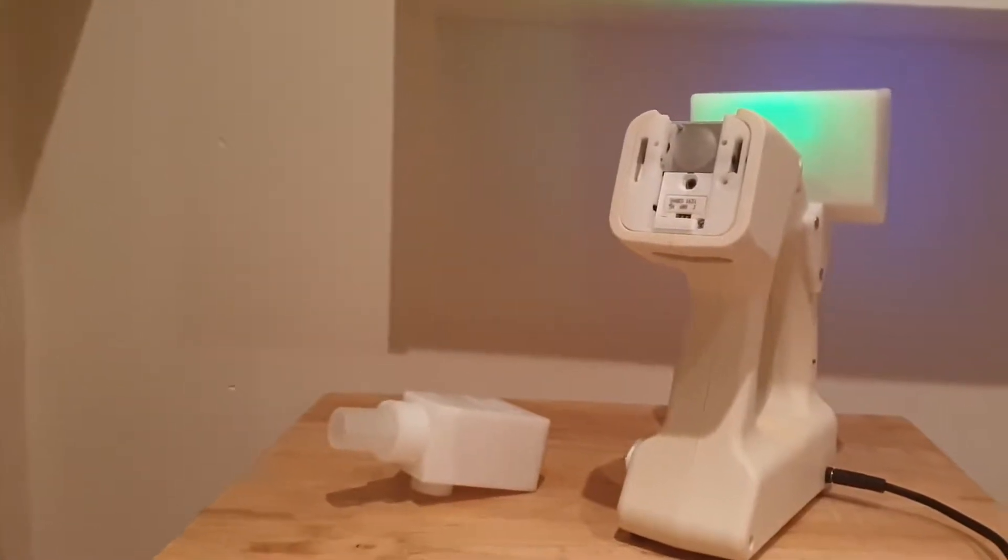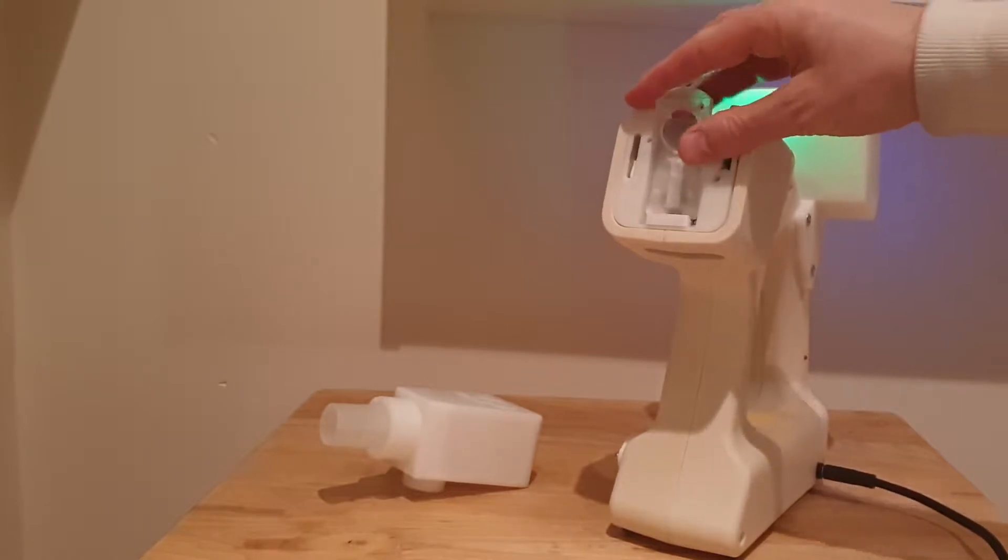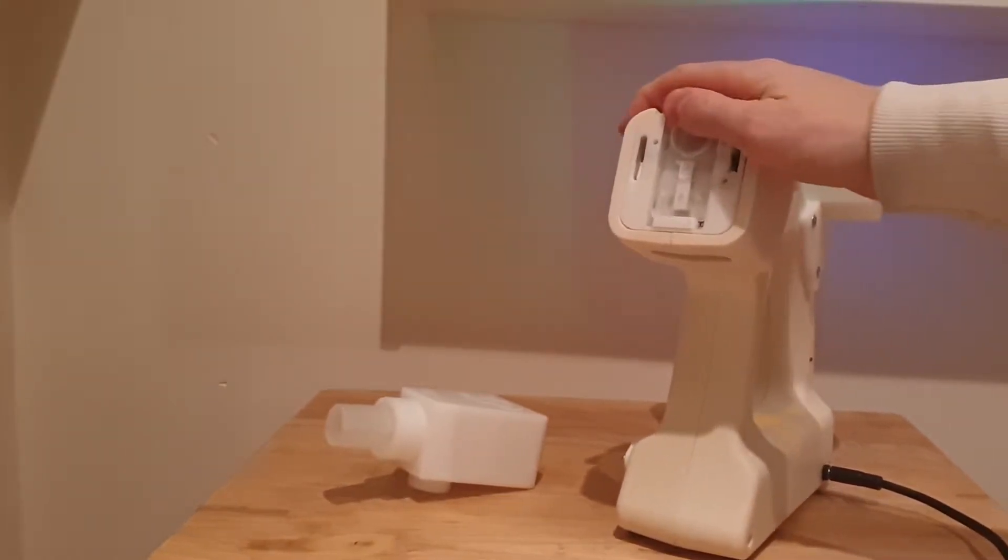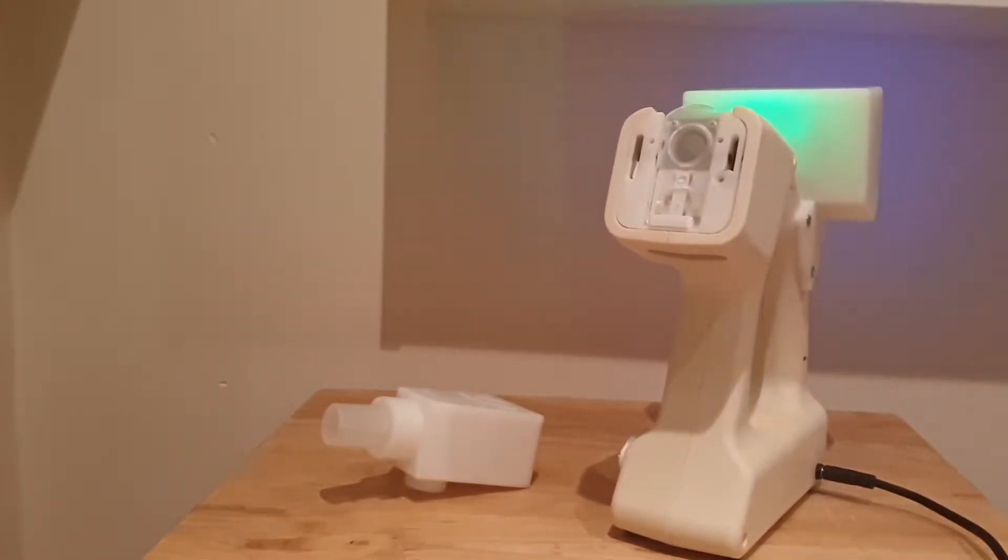Hi, so this is just a quick video on ZP's technology for sampling the gas phase and vapor phase. So what we have is a cartridge for collecting the vapor phase. So I've just plugged the cartridge in there.